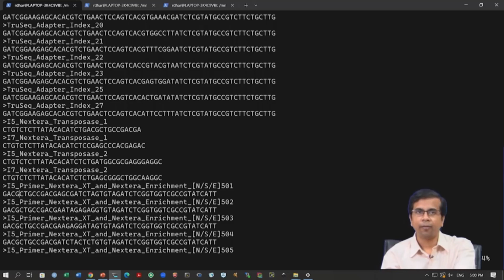adapter sequences. Now, why am I showing this adapter file? Why do you need to know about this file? Imagine you are using some adapter sequences that you have designed yourself. These are not commercially available adapters, these are adapter sequences that you have designed for your experiment for whatever reason. Now, this adapters.fa file will not contain those adapter sequences. So, in your data, if you see some sort of adapter contamination, you want to update this file to remove that adapter contamination. So this is something you have to add.